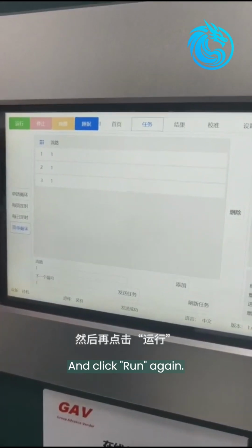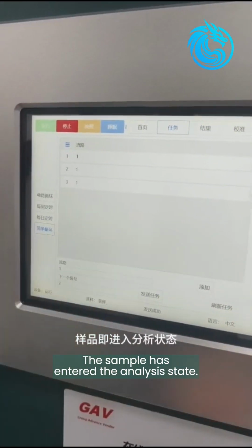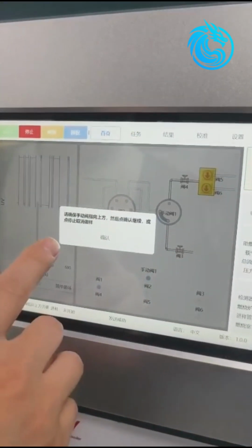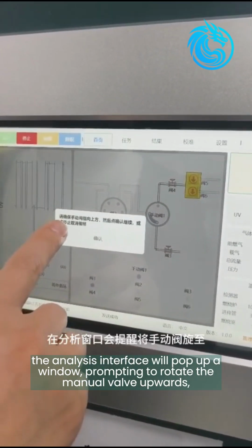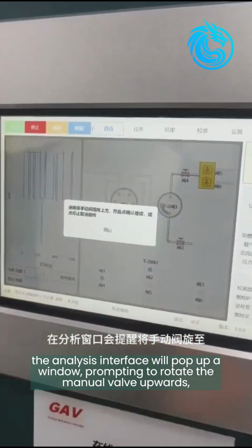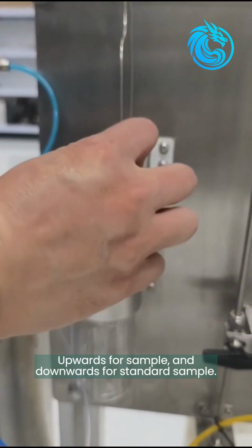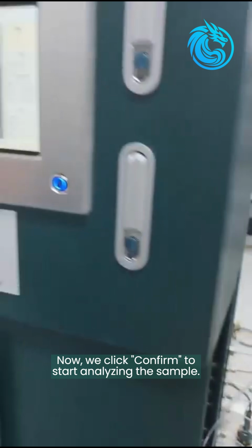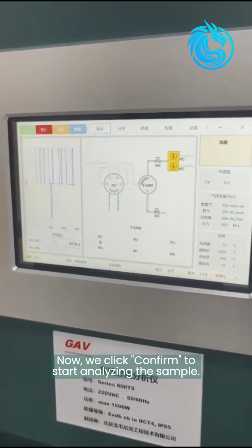And click Run again. The sample has entered the analysis state. If a standard sample has been done before, the analysis interface will pop up a window, prompting to rotate the manual valve upwards. Upwards for sample, and downwards for standard sample. Rotating upwards means it is to analyze the sample. Now, we click Confirm to start analyzing the sample.